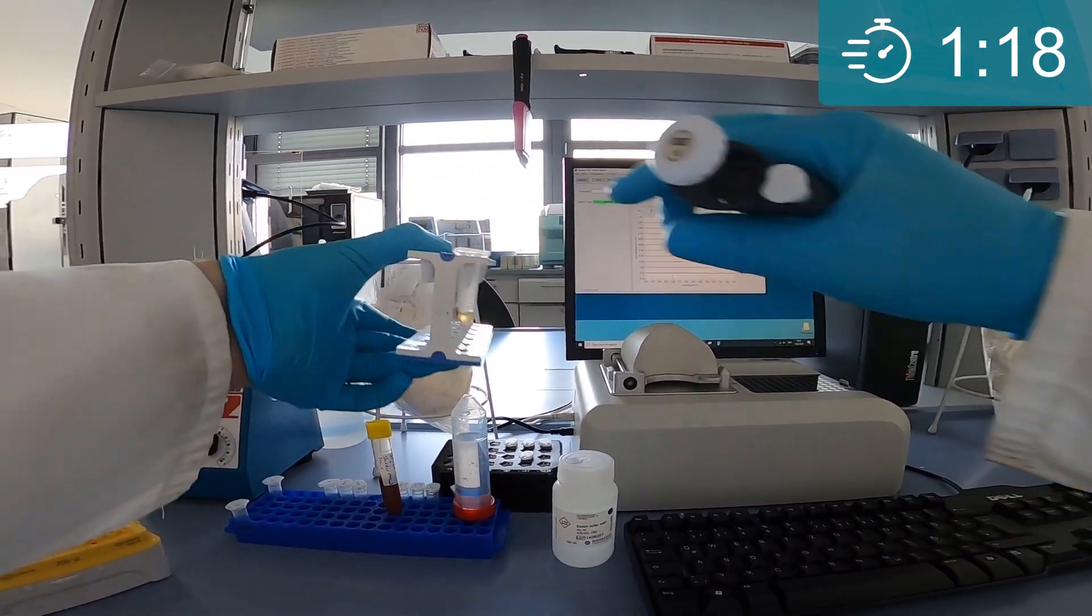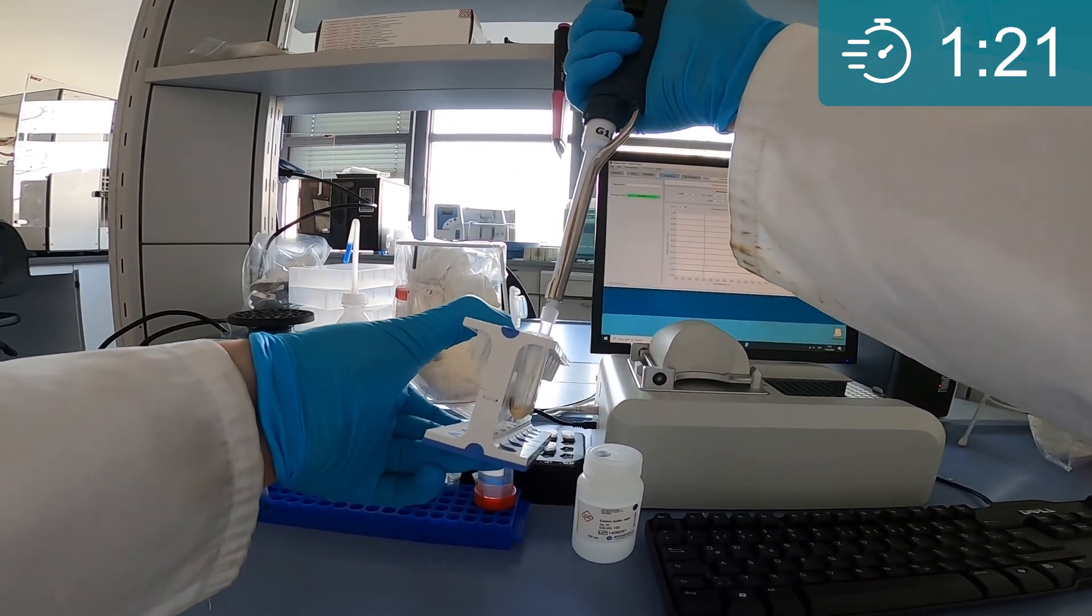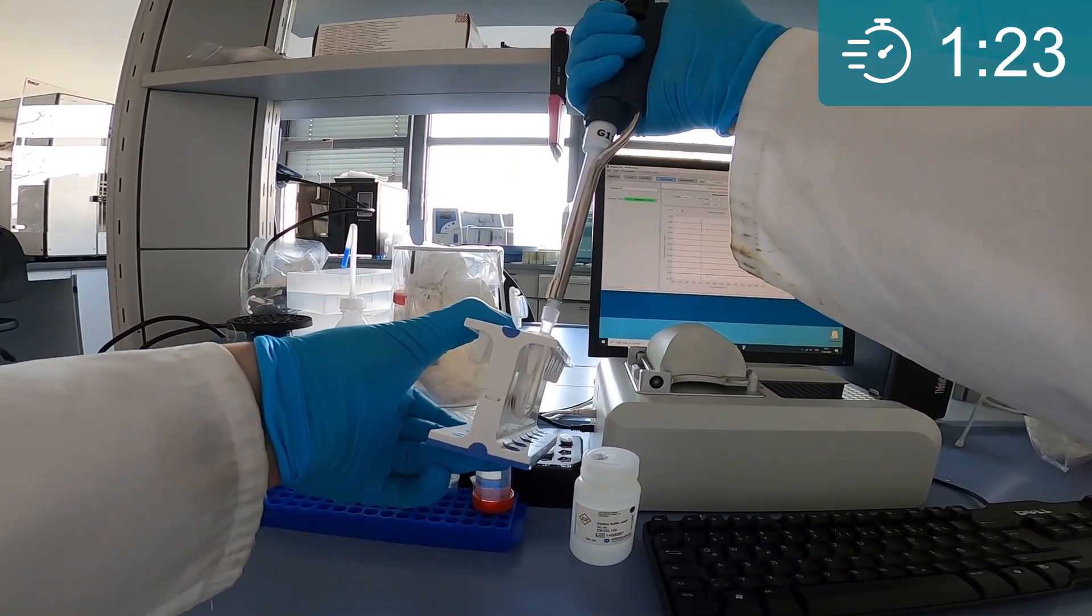Try to remove as much of the supernatant as possible. Make sure that when removing the liquid, you do not disturb the pellet.